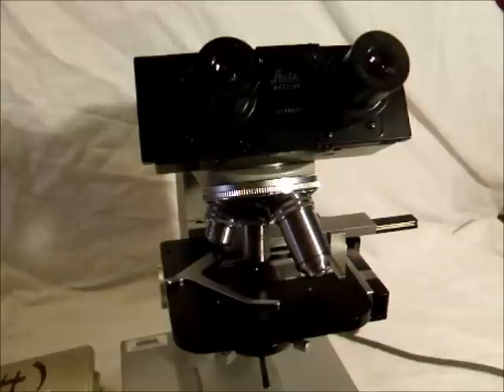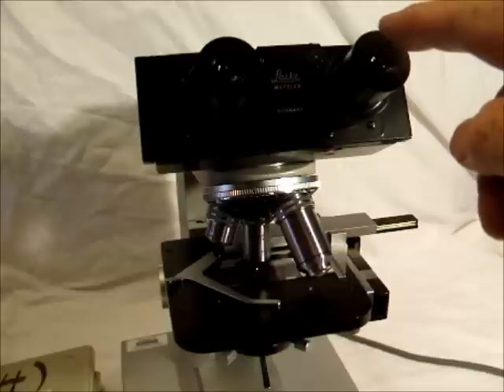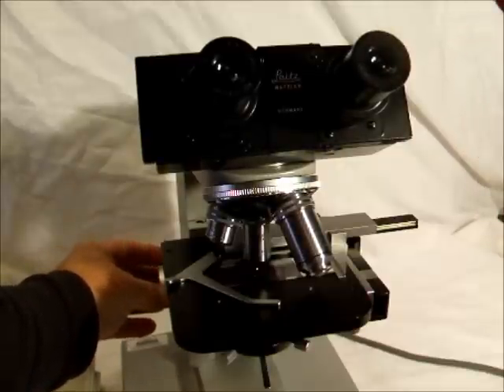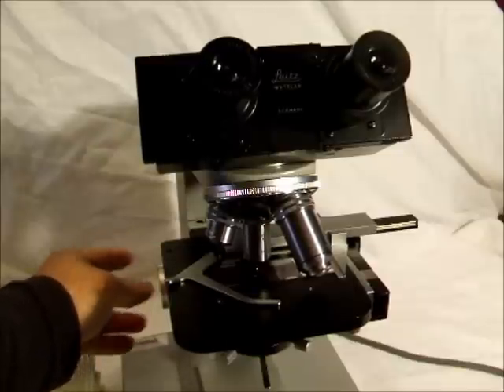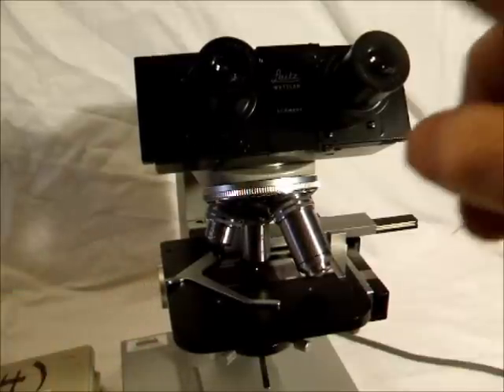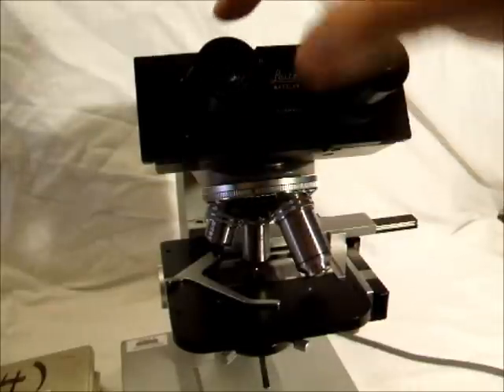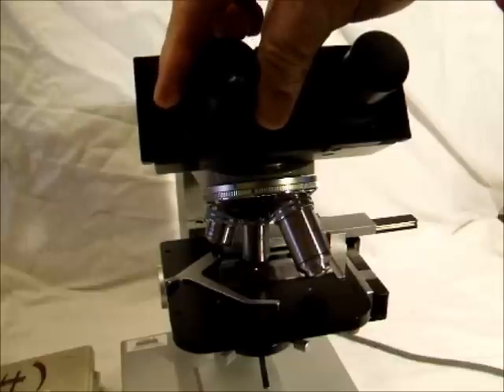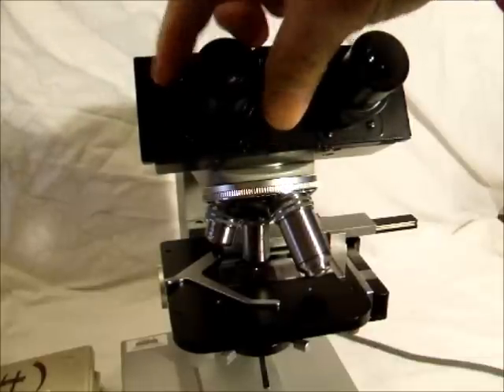Step 5. Look through the right ocular lens using just your right eye. That is, close your left eye. Adjust the focus until the image is sharp. Then, using just your left eye, rotate the left ocular lens until the section is also sharp. At this point, both ocular lenses should be adjusted to your eyes. Again, this setting may be different for your lab partner.